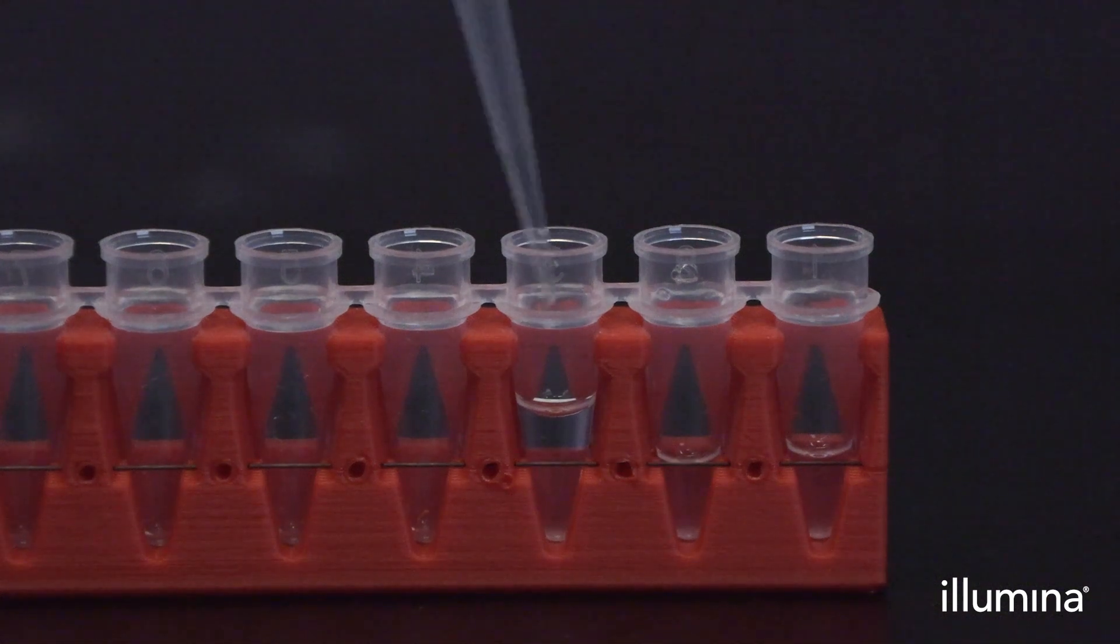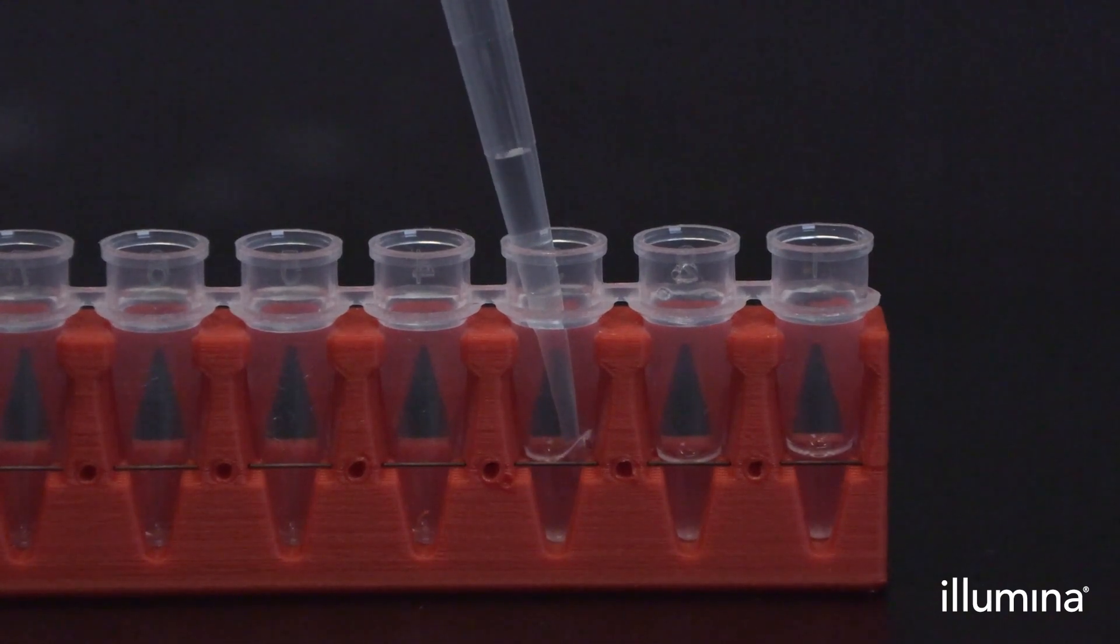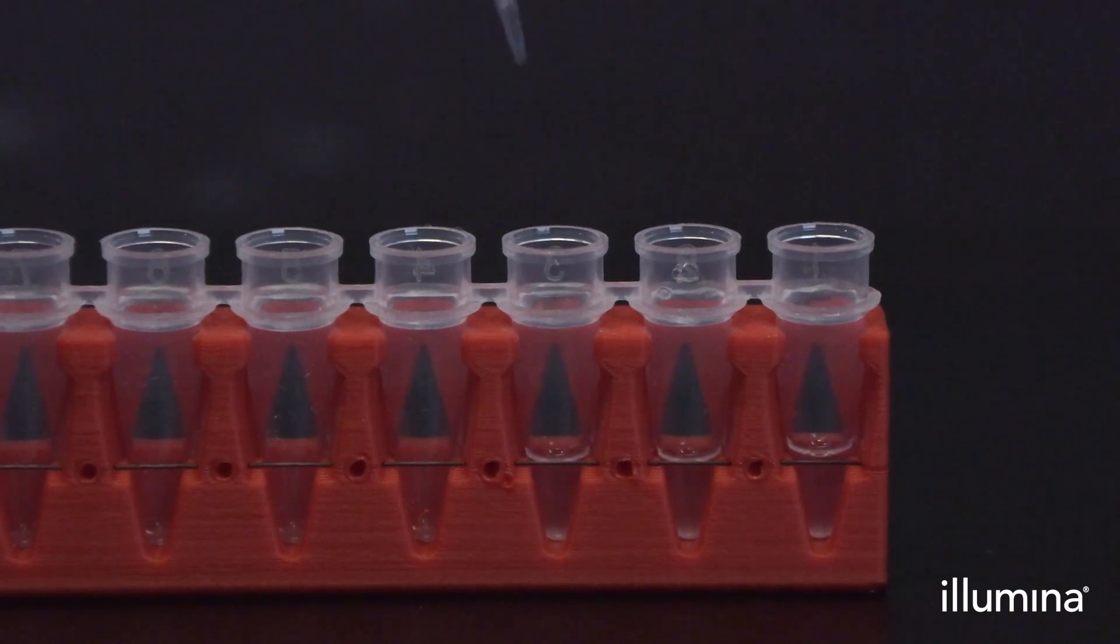This is critical to ensure proper volume regulation of the sample for mixing with our RT master mix. Users can then proceed to reverse transcription.